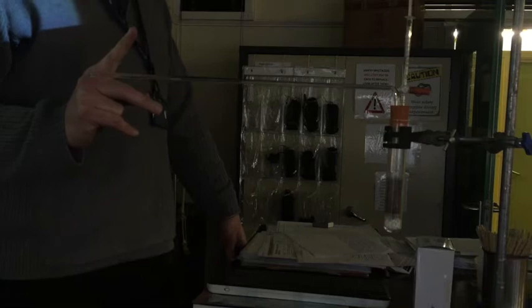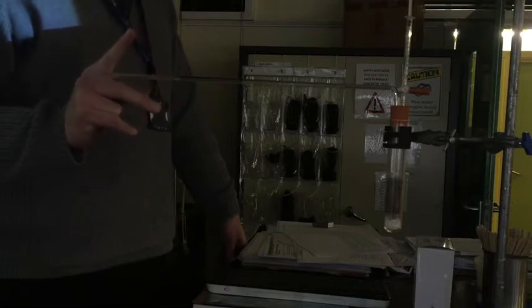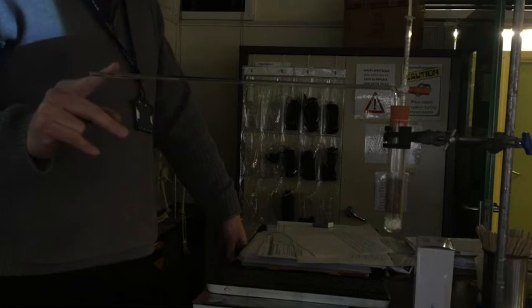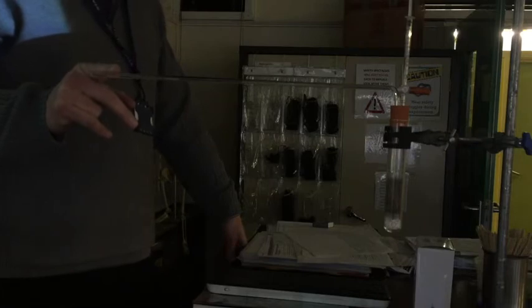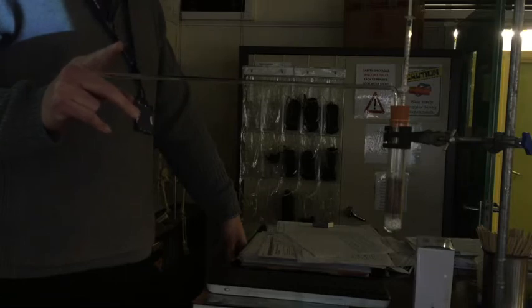To measure a rate, what are the two things we need to know? What are the two things we need to know for a rate? Like rate of change of speed is distance divided by time. What's going to be, how do we work out the rate of oxygen use? This is going to move, isn't it? So what could we measure about this? Speed. So we can't measure speed directly, we need two variables to calculate speed. So what's the first variable we need? Distance. So you're going to take one of the marker pens here, and before the experiment starts you're just going to put a mark, and then you're going to use a stopwatch for the time element, and you're going to time it for one minute.